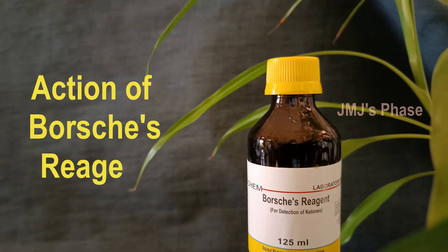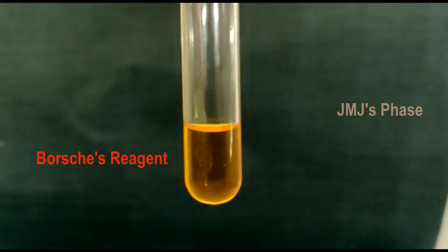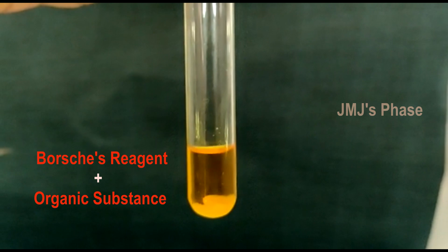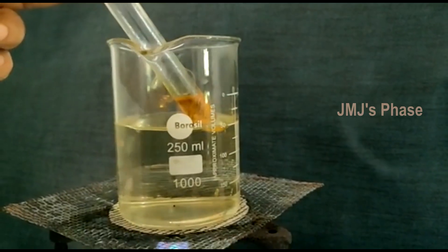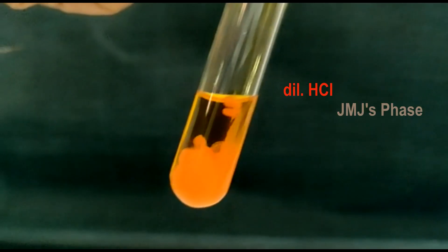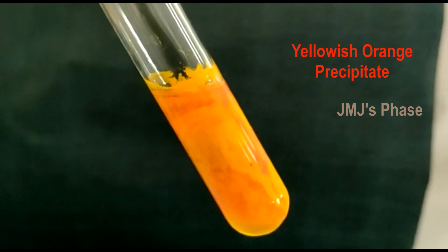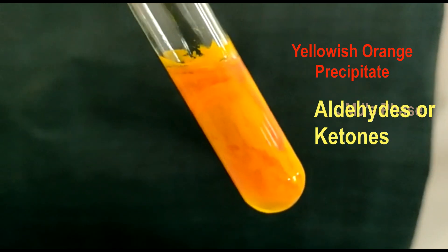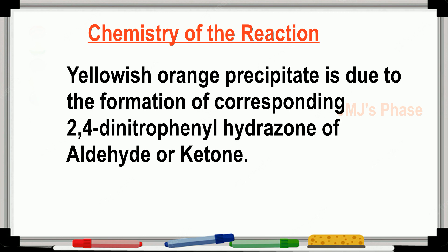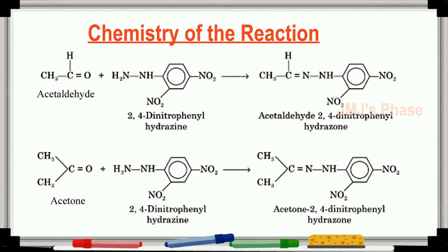Action of Brady's reagent: Take about 2 ml of Brady's reagent — that is, 2,4-dinitrophenylhydrazine — in a test tube and add a little of the substance into it. Keep it in a boiling water bath for a while and add a few drops of dilute hydrochloric acid. A yellowish-orange precipitate shows the presence of aldehydes or ketones. This precipitate is due to the formation of the corresponding 2,4-dinitrophenylhydrazone of the aldehyde or ketone.